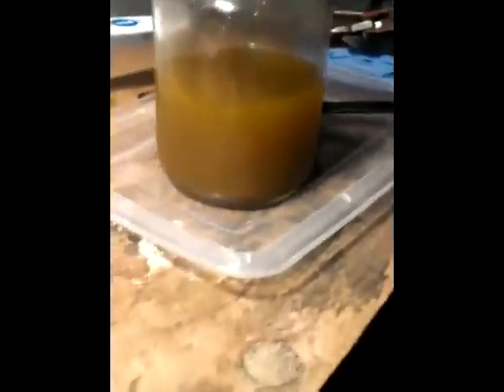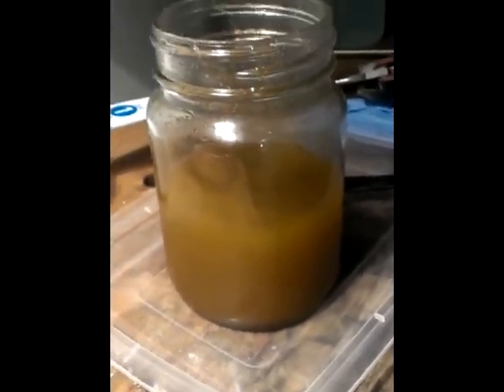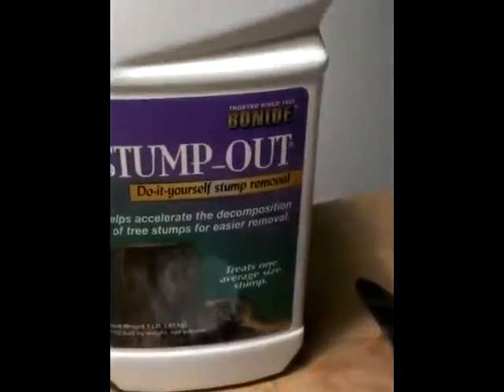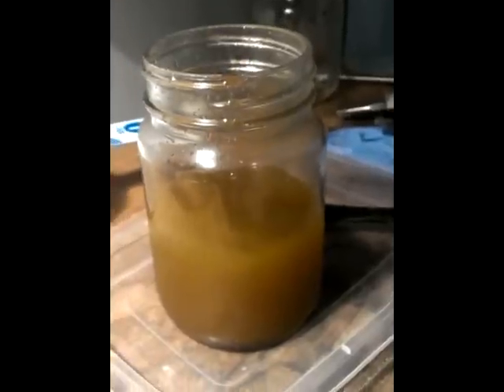And then I will test the liquid with stannous chloride — that will let me know if there is still gold in the liquid. And if there is, then I will add more stump out and drop the rest of the gold. So we will follow up.